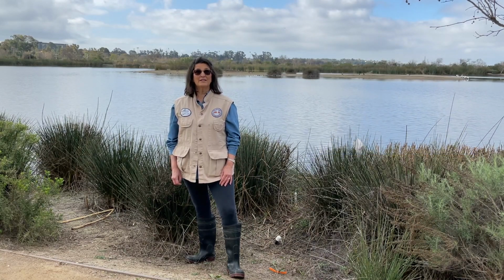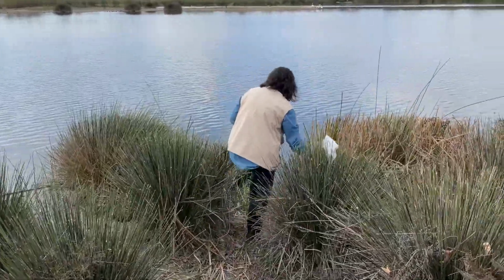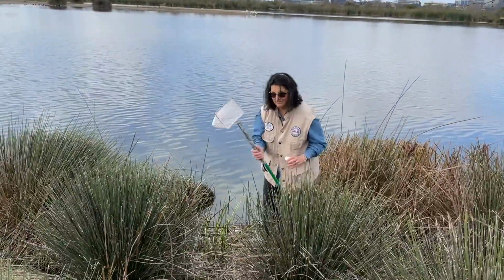First of all, we need to sample the water. So I'm going to go in and show you how I get a sample of water.